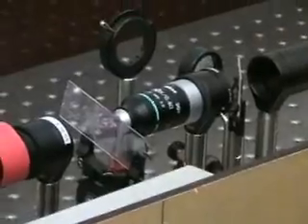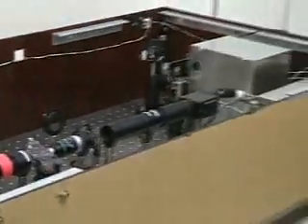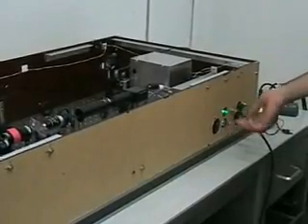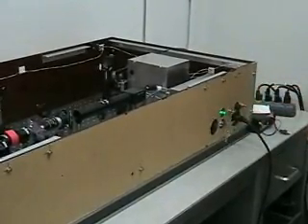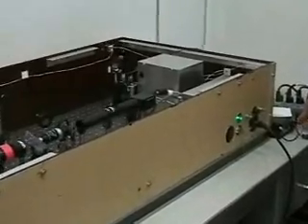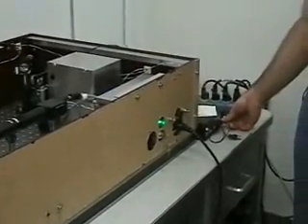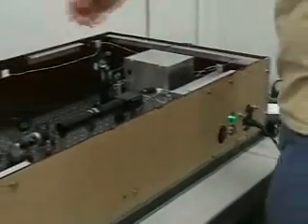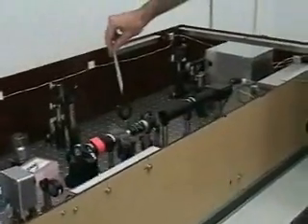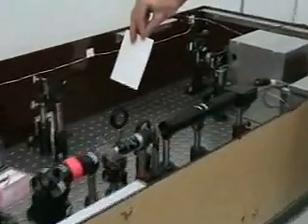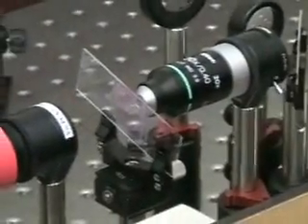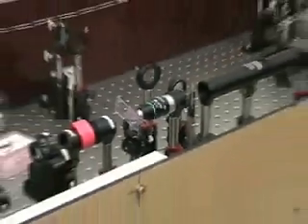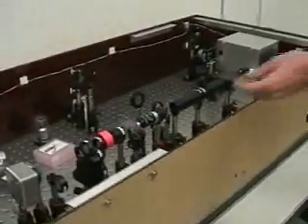And then notice that I've got my lamp here turned off, and I've turned the laser on. So you'll see this green LED. And furthermore, the switches will eventually be up here, but I've actually opened the shutter so that the laser beam is coming out on the table. And you'll be able to see it. If you put a card here, you can probably see the green spot even scattering through the card. It's coming over here, and you'll see it actually comes through the sample.